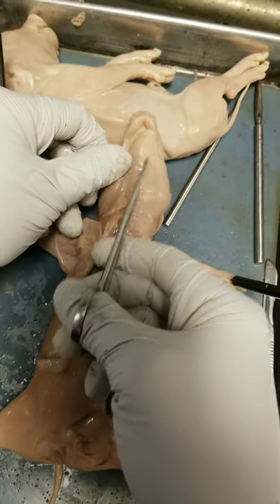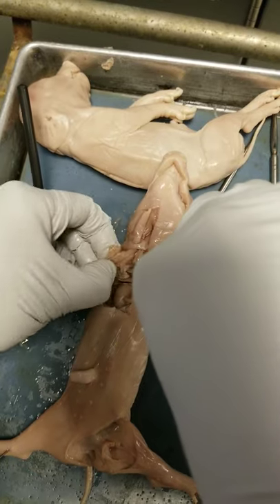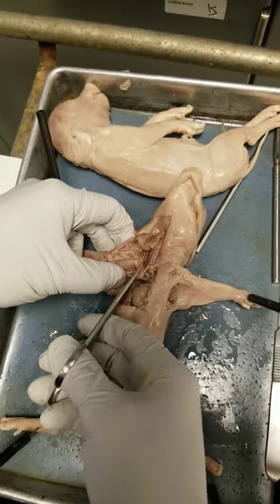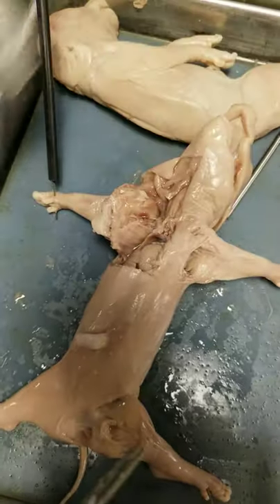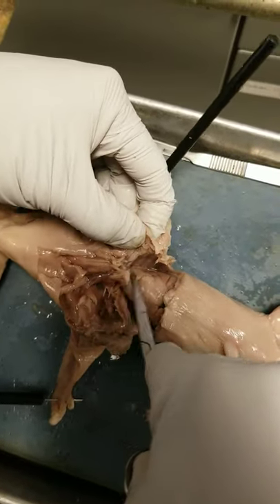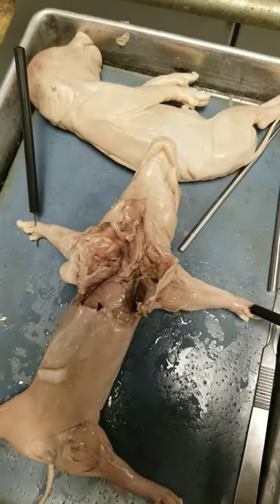I'll cut the skin first, all the way up to the throat, and we want to peel it away like a door. I'm cutting the ribs here, just to get that cavity open a bit more, and now the other side. A bit more up here just to separate out some things.